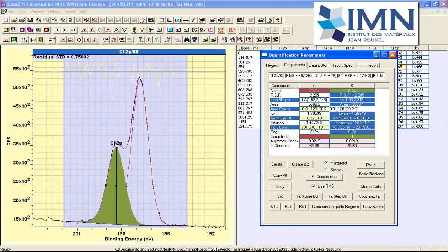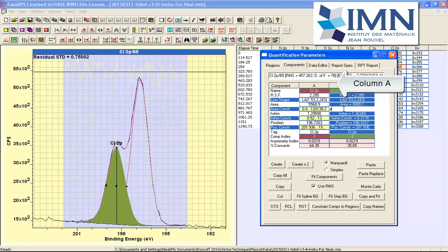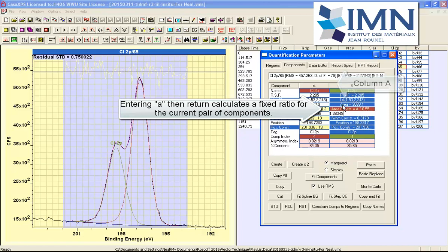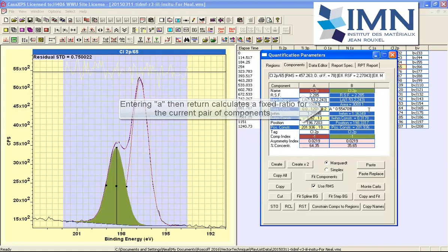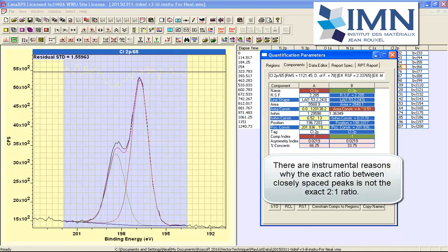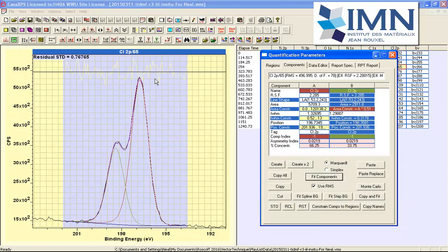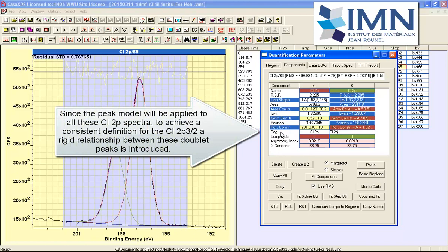So let's now introduce a constraint, and I'm typing A. This is referring to the A in column A, and when I press return, it will calculate the area of column B relative to column A. So it believes it's more than half, so let's just make that 0.51, and you can see the residual then is damaged by introducing this constraint. But when we say fit, well, it goes back to being a reasonable residual. So as far as fitting these data so we get a consistent answer for the peak position of this peak here, then this constraint is working well. We've got a good representation of the data, and we can go and fix these other constraints of full width at half maximum and position. So we really have quite a rigid model that's based on this one spectrum.